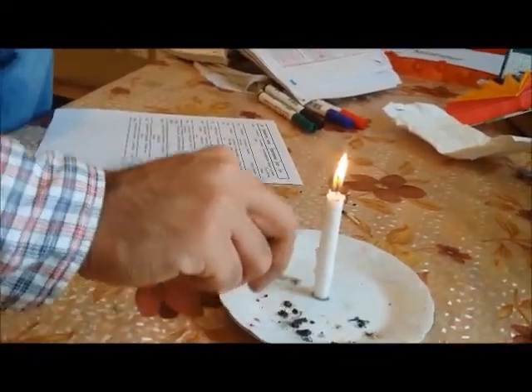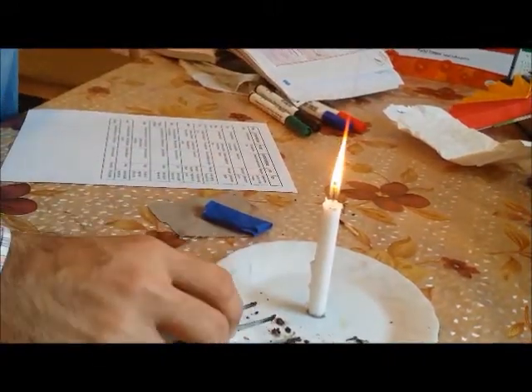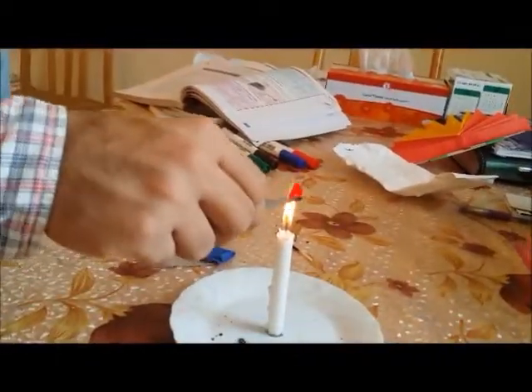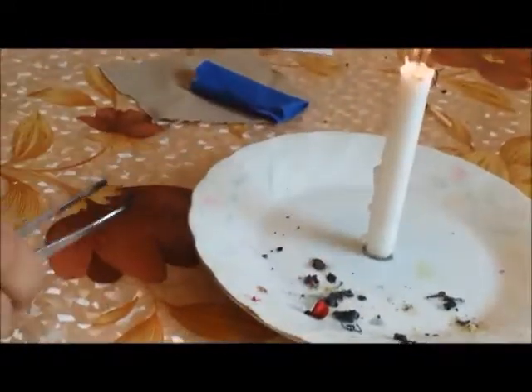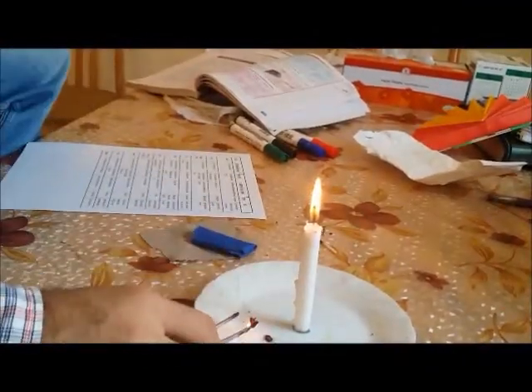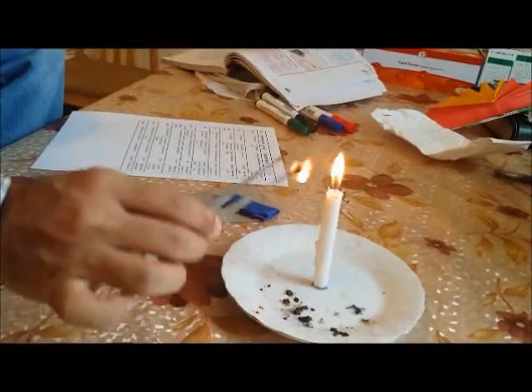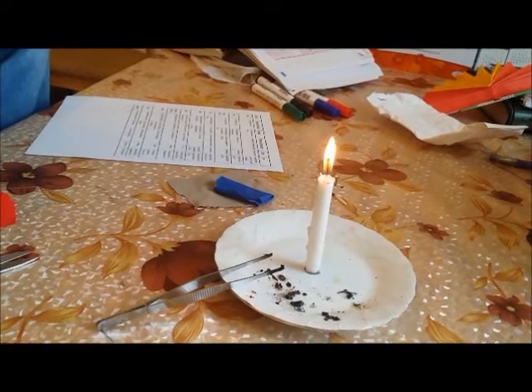And see how sticky it is — just like a mozzarella cheese. When brought out of the flame it burns with great difficulty — not so easily burning. What about its odor? The odor is just like a chemical — just like how you smell it near a petrol factory. Flickering and melting. Just like a chemical factory, the smell comes.